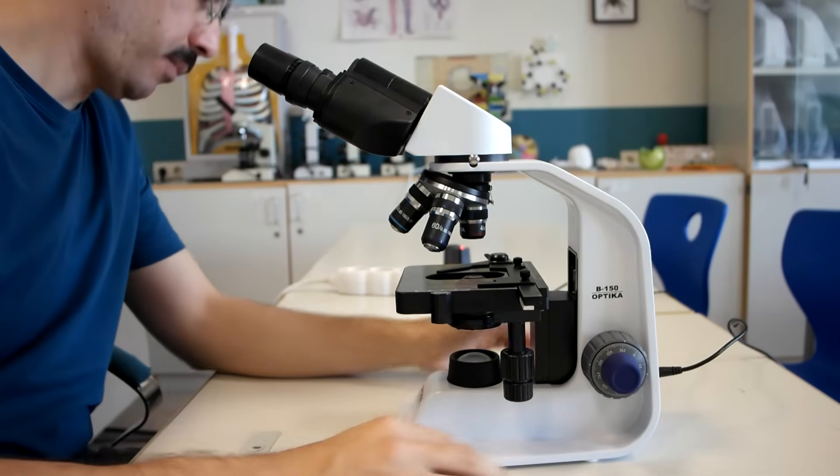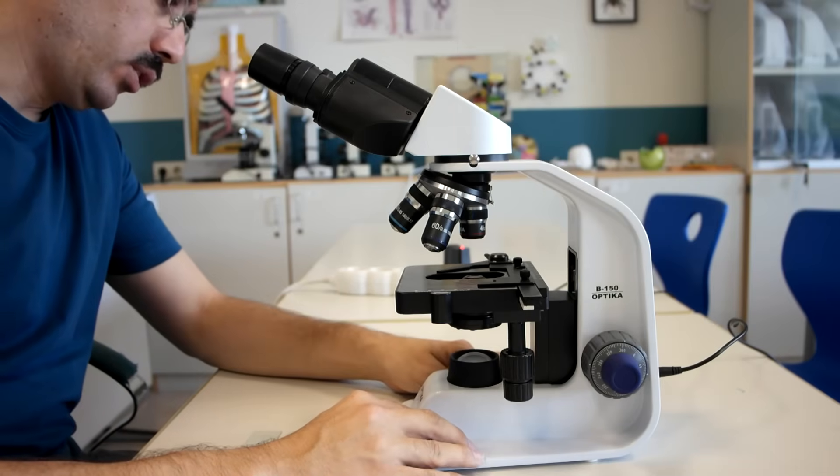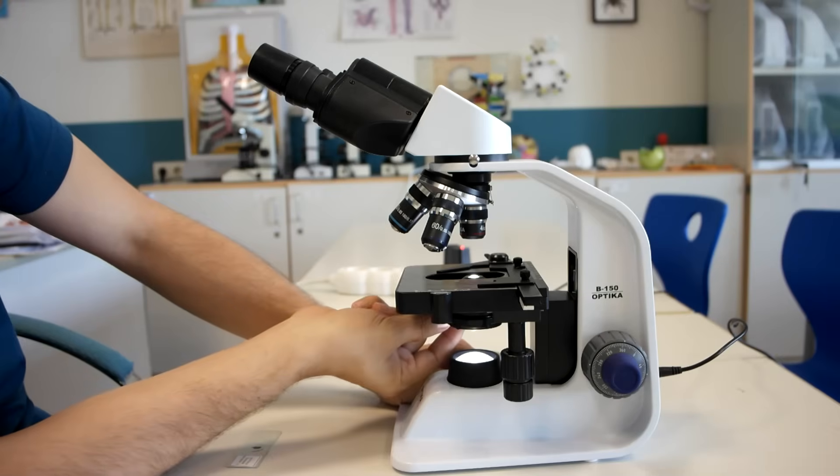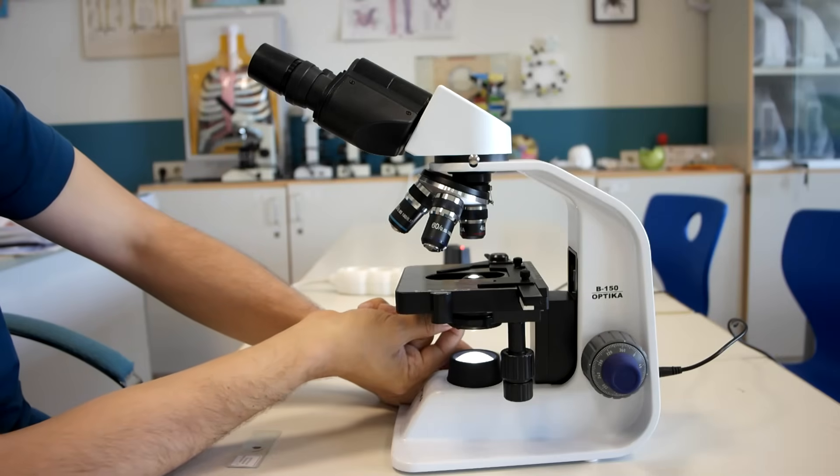So how do we begin? Turn on the microscope. See the light coming up. You can adjust the light with diaphragm as well if necessary.